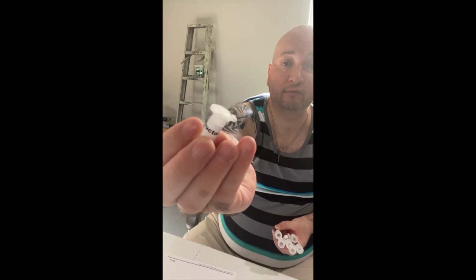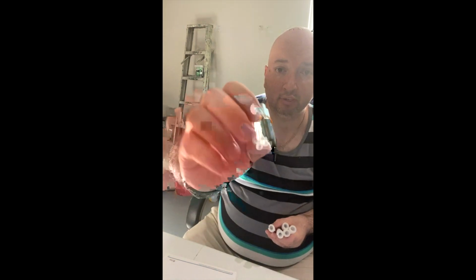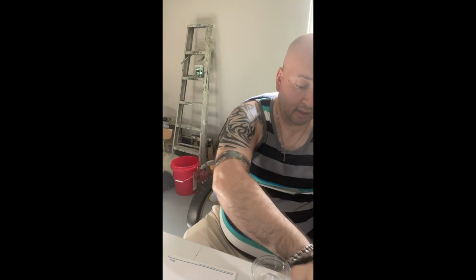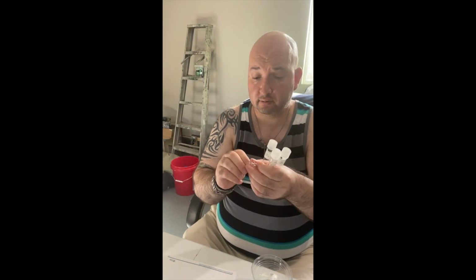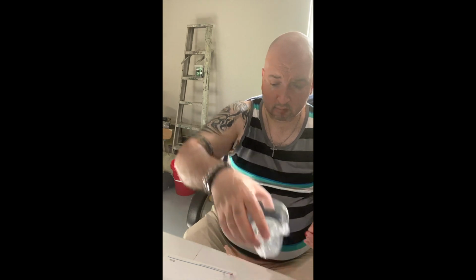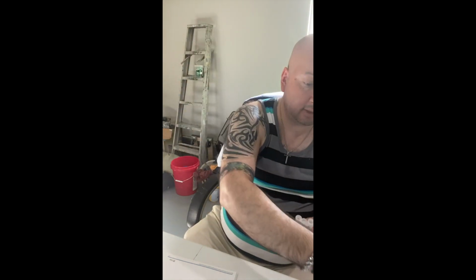I also have the powdered sugars in here. So this is mannitol. This is glucose powder and fructose powder. These are the Durham tubes that are going to go into the phenol red here. I also have a cup of alcohol with 2 pipettes that are sterilizing, and I'm going to put the 6 Durham tubes in the alcohol to sterilize right now. I don't know if you can see them very well, but they're in there, sterilizing.